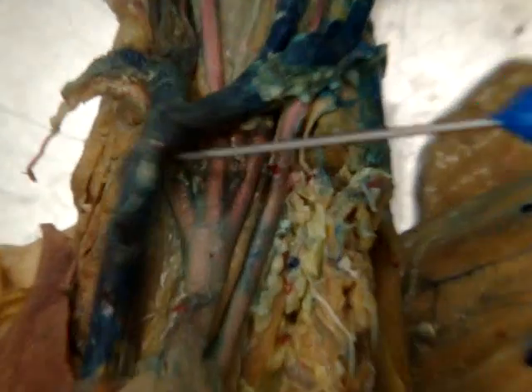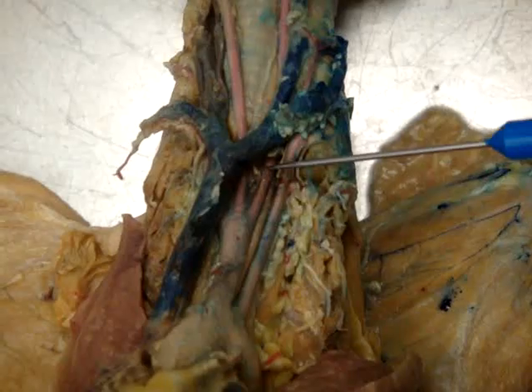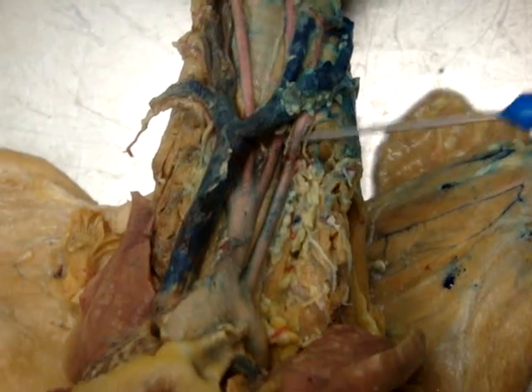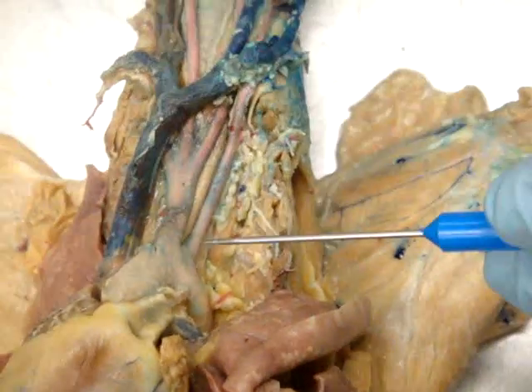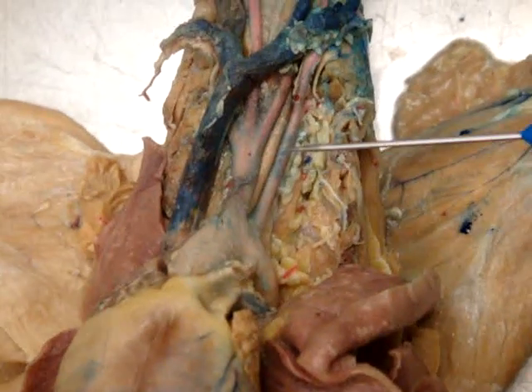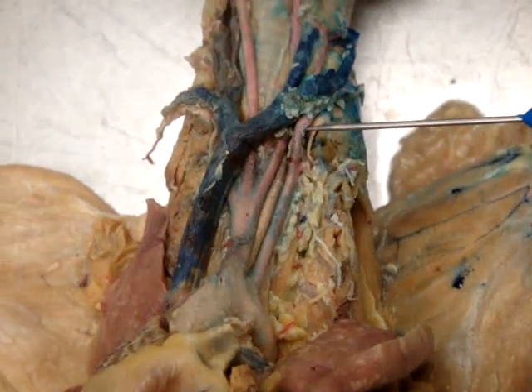The next branch of the brachiocephalic is the right common carotid. Then the last branch of the brachiocephalic is the left common carotid. And then coming independently off of the aortic arch is the left subclavian.